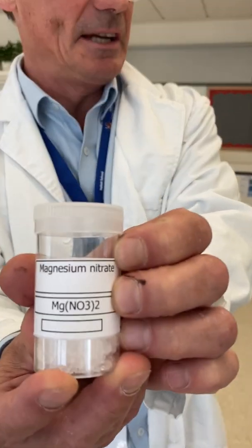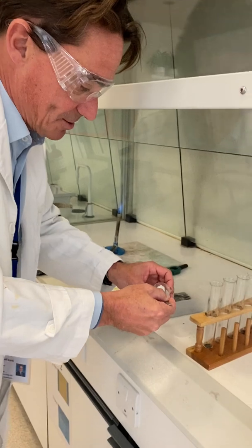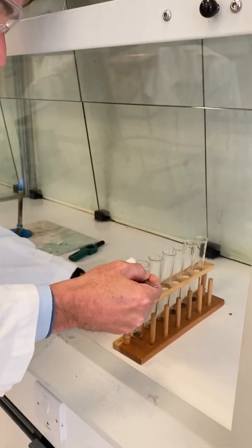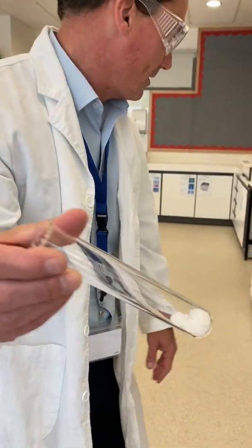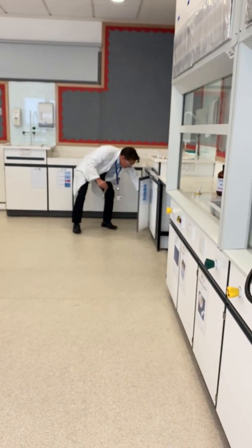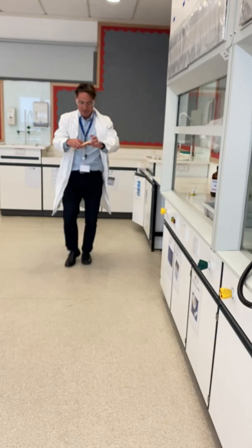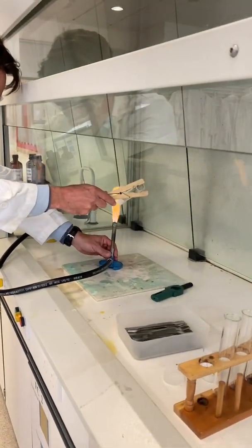I've got some magnesium nitrate here. The trend is going to be exactly as we saw with the group 2 carbonates before. Let's see what happens when I heat some magnesium nitrate in a boiling tube here.